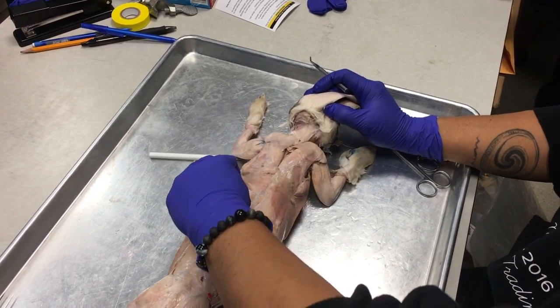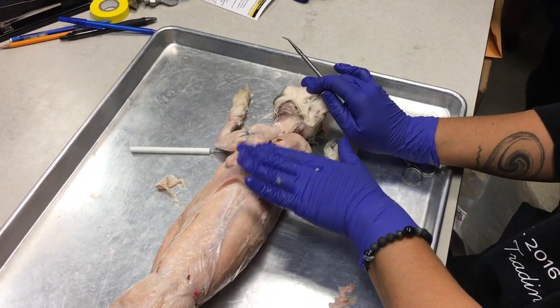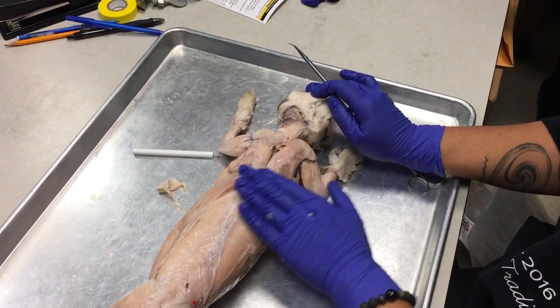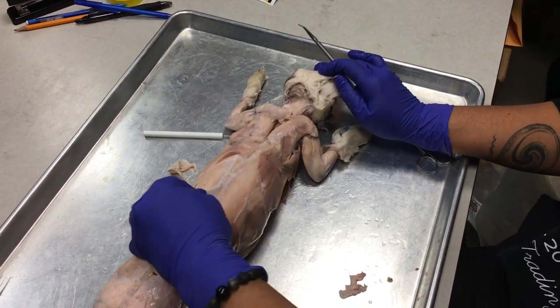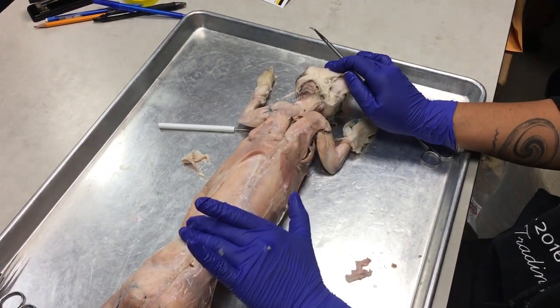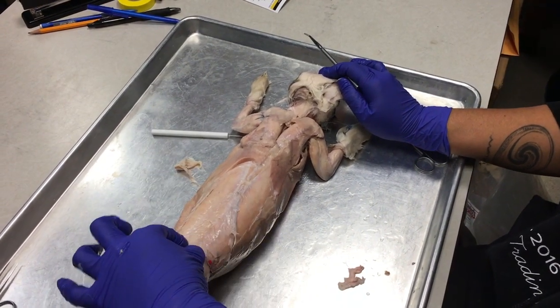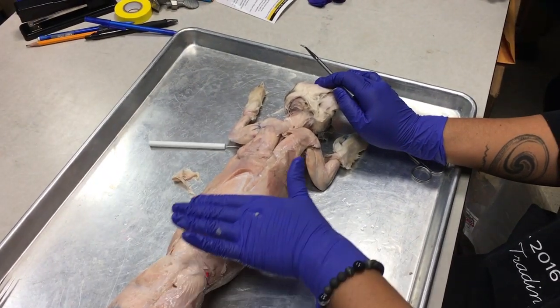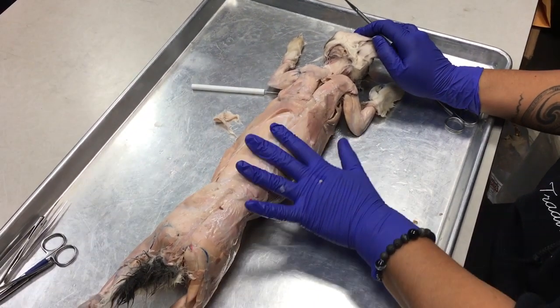Now deep to that and underneath the fascia that's up here in the lumbar area is going to be your longissimus dorsi. We didn't reveal that in the last class, but we did take up this huge thick fascia back here. So it's super thick, right? So if you cut up underneath that, you're going to see this long muscle here, and then two shorter fibers that are more medial than these muscles. So first of all, this fascia is called the thoracolumbar fascia because it goes from the thorax to the lumbar region.